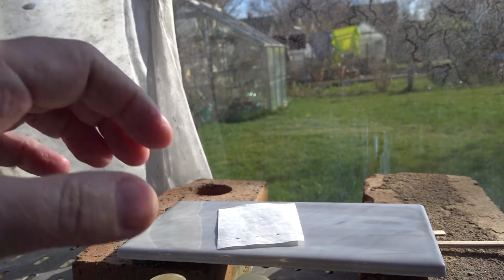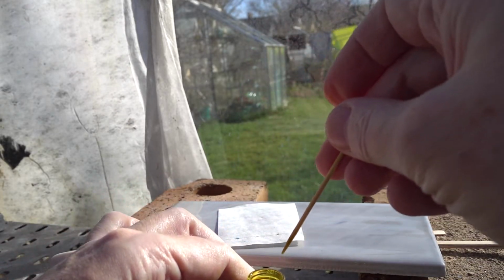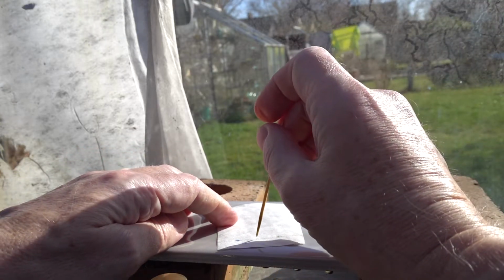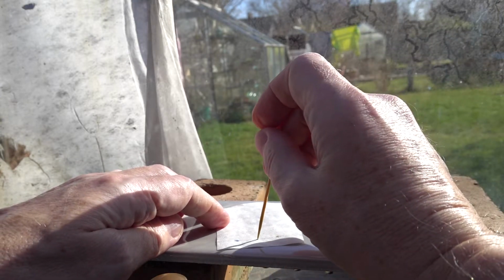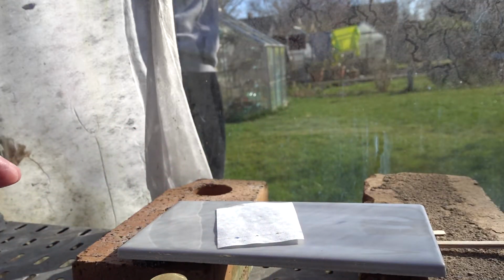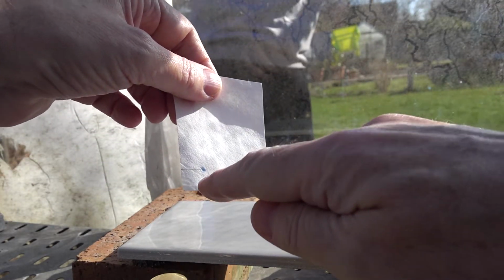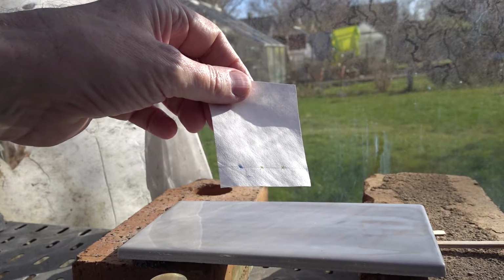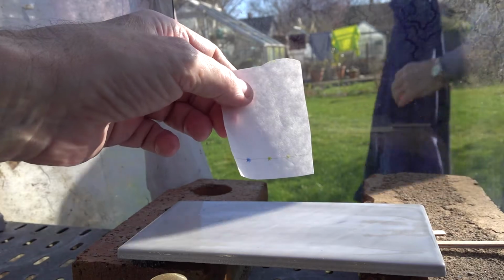Next, we'll have a look at the green. And that one goes in the centre. Again, a nice small spot. We're not looking to get a big spot of the material. And now we've got our 3 samples there, blue, green and yellow. Well, we have of course got to let those dry, so here's one of blue, green and yellow prepared earlier, which is nice and dry.